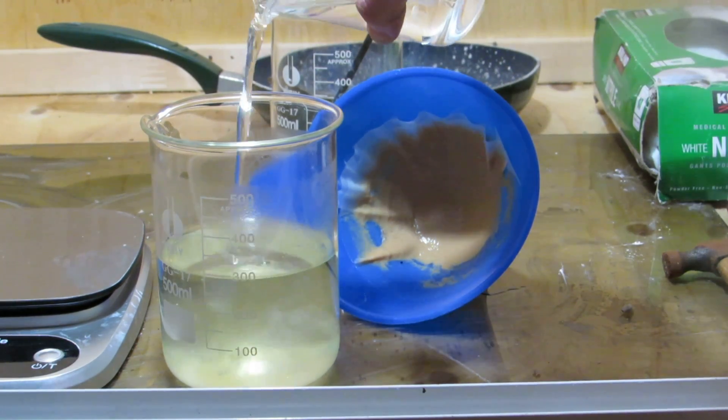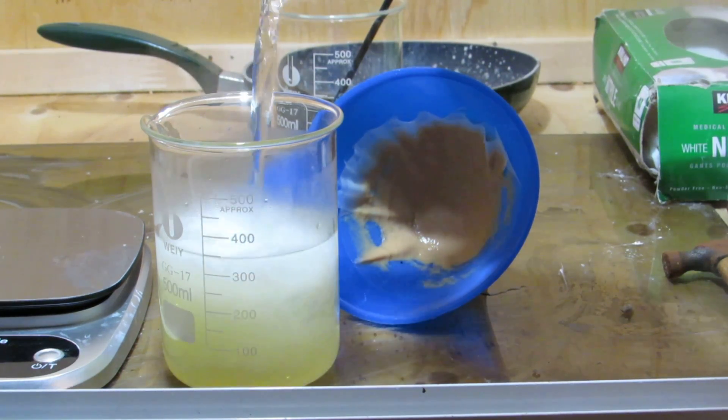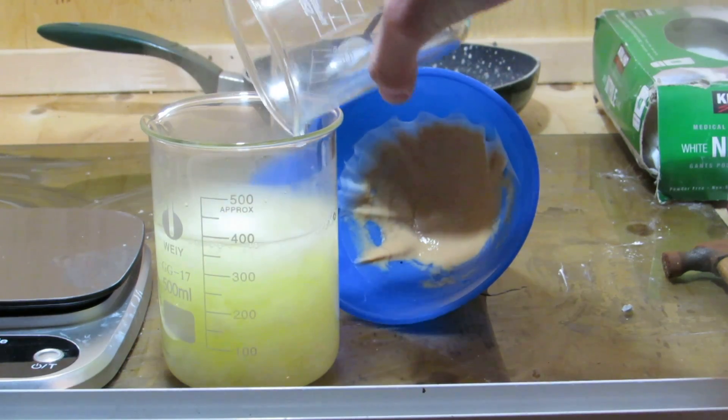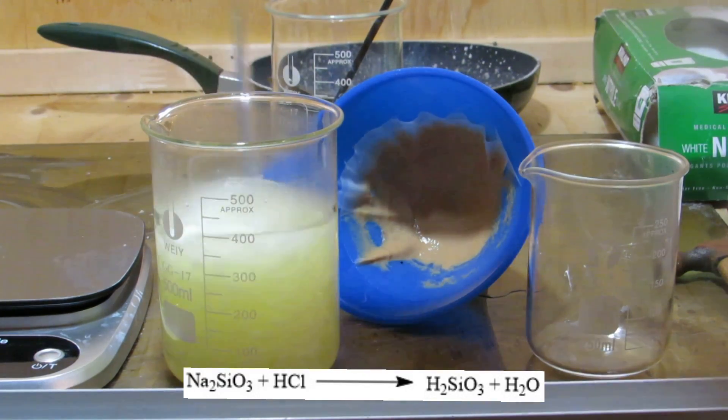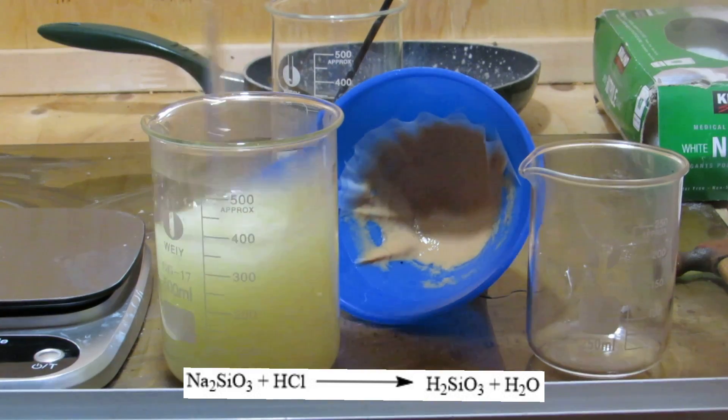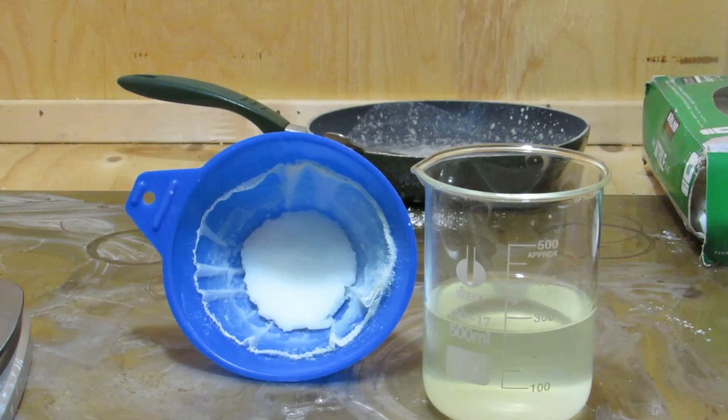The acid reacts with the sodium silicate to produce silicic acid which is insoluble and precipitates out. The silicic acid was then filtered, which took over a day because it was quite gelatinous.